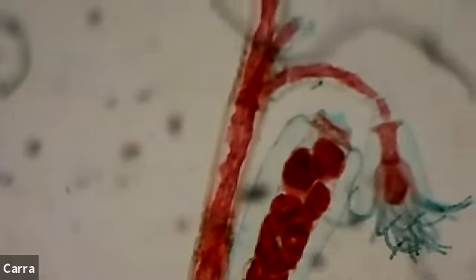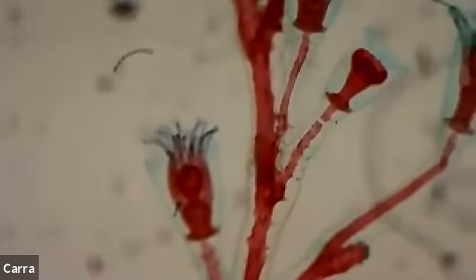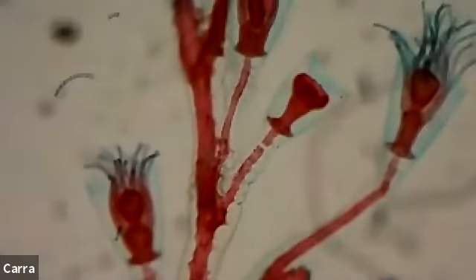So let's take a look and see if we can see any others on this particular stalk. So here we have one up here. You can actually see two of them here. And so in this form, when they're connected to all of those branches in the stalk, that's going to be a polyp form. It's sessile, right? It's non-mobile, okay? But if that tip popped off, it could invert itself so that the tentacles are down. It would be a medusa form and it could float through the water column.